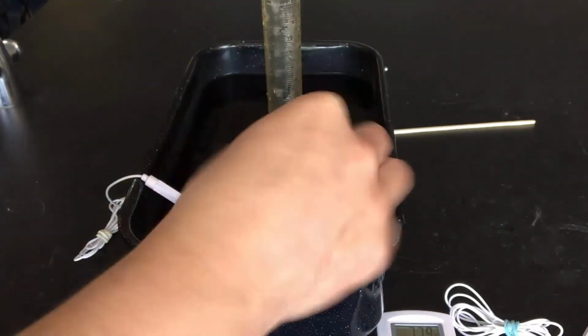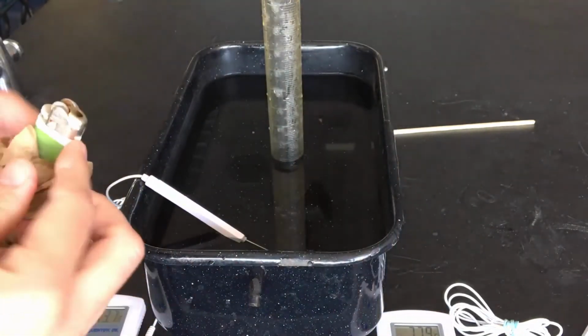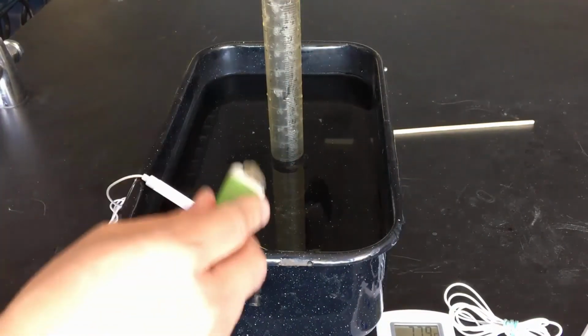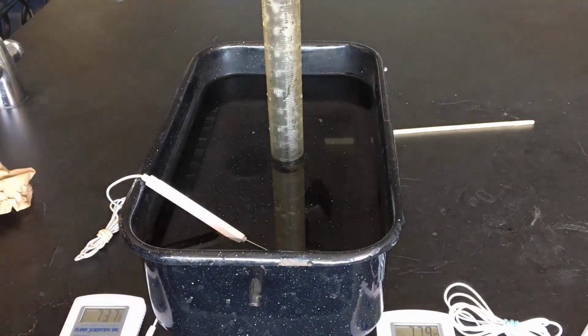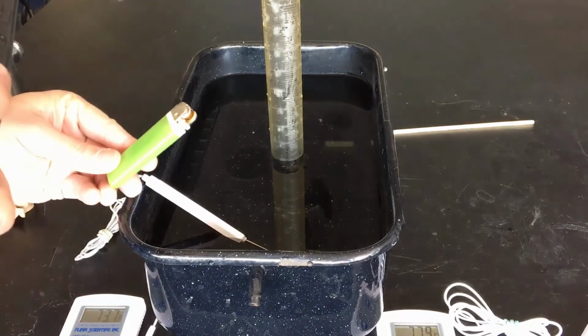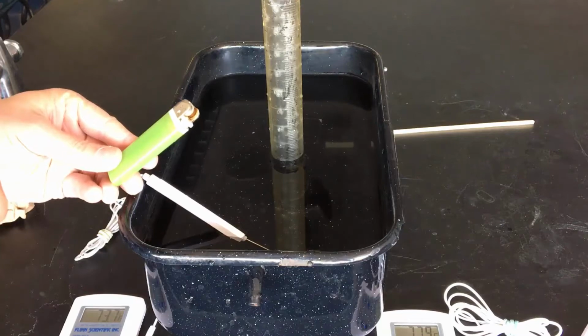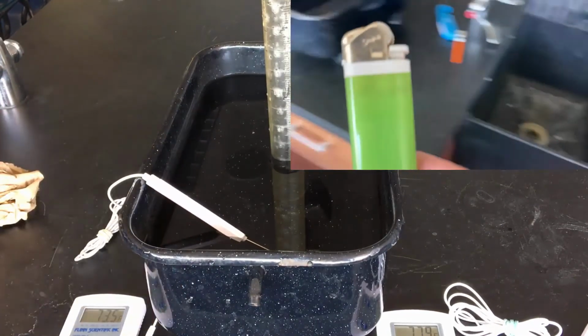Now, the assumption is that the water clinging to it now is equal to the amount of water that was clinging to it at the beginning. That's not necessarily true. This is very much a source of error that we have to account for. But if we assume that, then when we go to our scale, whatever missing mass there is must have been butane. So we'll go ahead and get that.